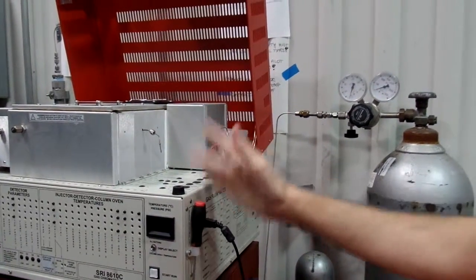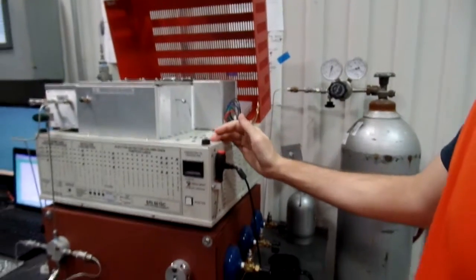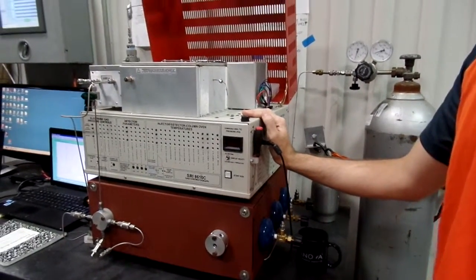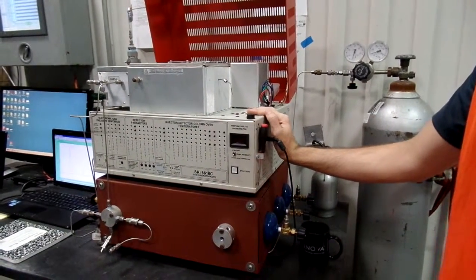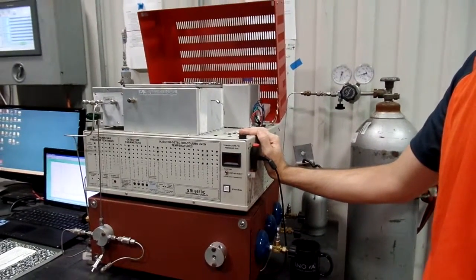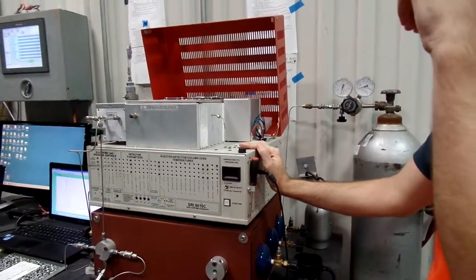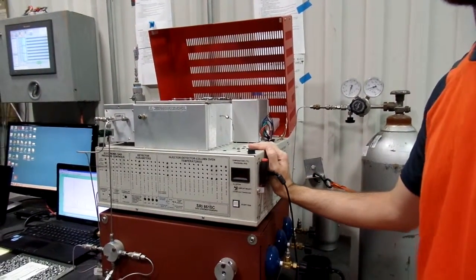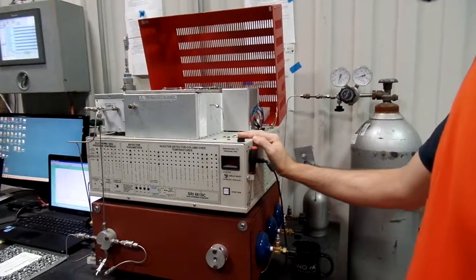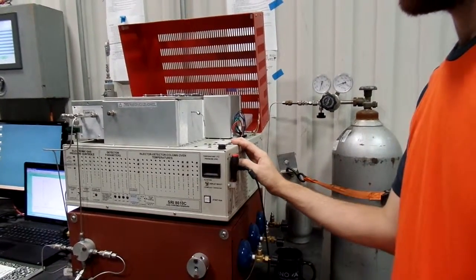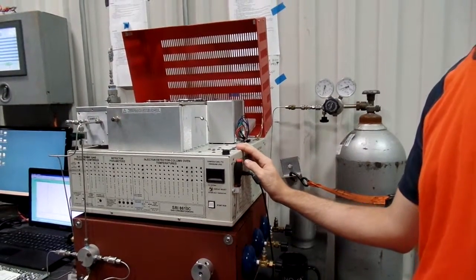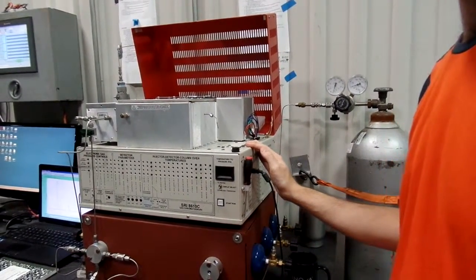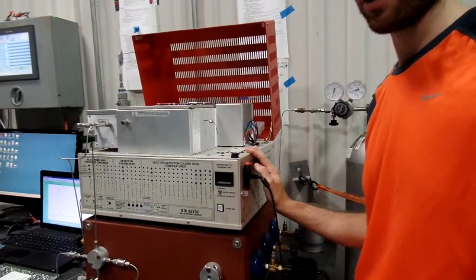And now it's on, set, flowing, and ready to go. You don't have to wait. It doesn't have a warm up. It doesn't need to. You can run sample through it and test it as soon as it's turned on. I would give it a minute, but I mean, it doesn't really matter. Now the only disparaging difference is your first test is probably going to give you a little fluctually wonky data that you don't want. So you just kind of run it once. It's that 30 minute kind of cycle time.